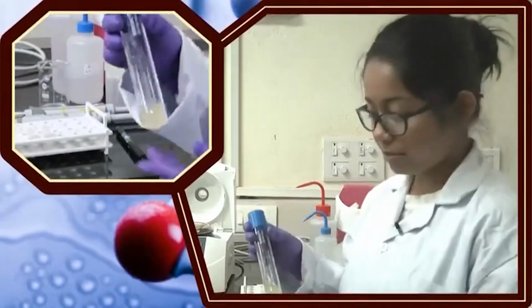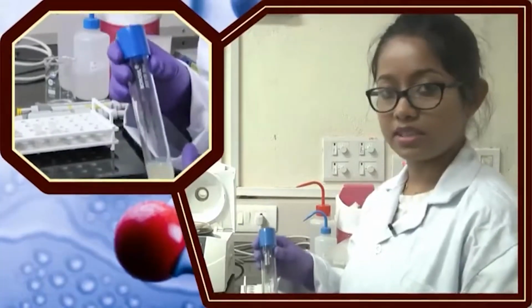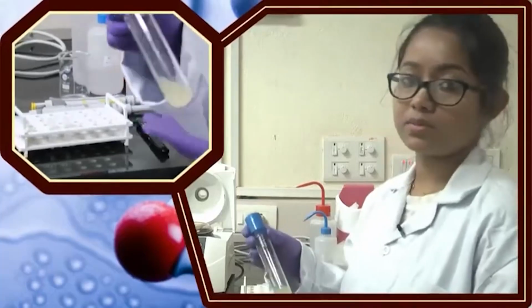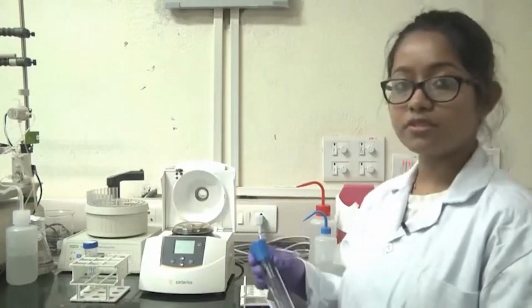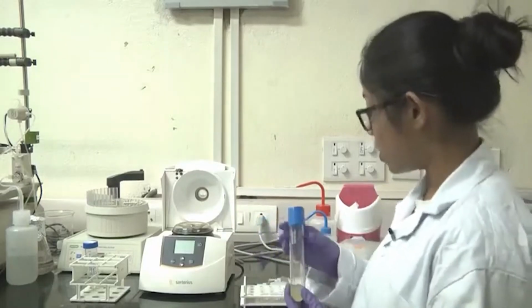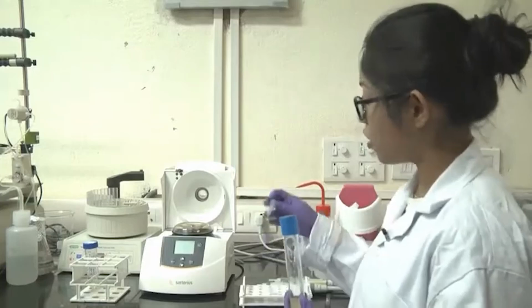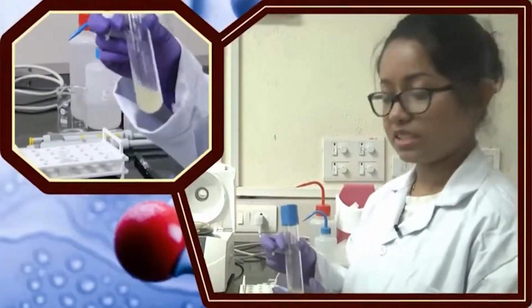So, now that I have prepared my culture and it has been grown for 15 hours at 37°C, I will isolate the plasmid first. To isolate the plasmid, I have to take the cells out of this media. So, for that I need to centrifuge this culture in a small Eppendorf tube in multiple goes, because the Eppendorf tube is almost 1.5 ml and I have almost 7 ml of culture here.